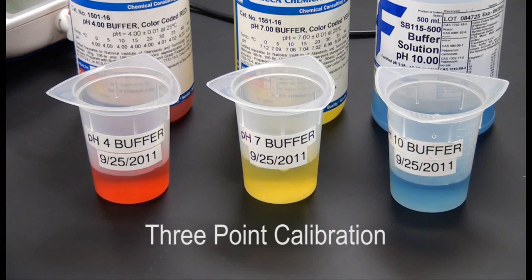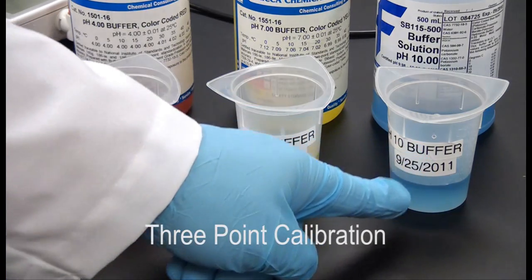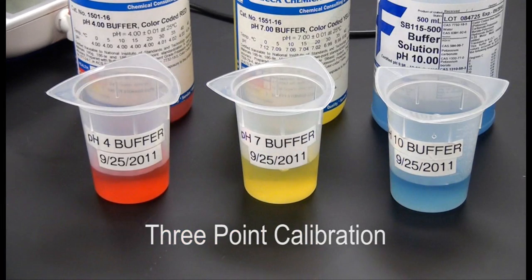To perform a 3-point calibration, perform the same steps as the 2-point calibration and repeat steps 3 and 4 for the third calibration point.